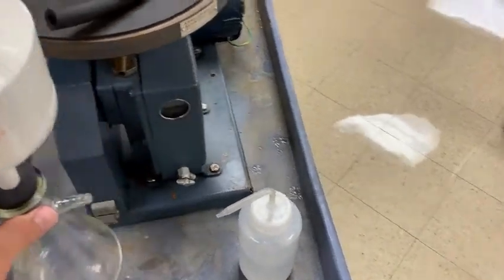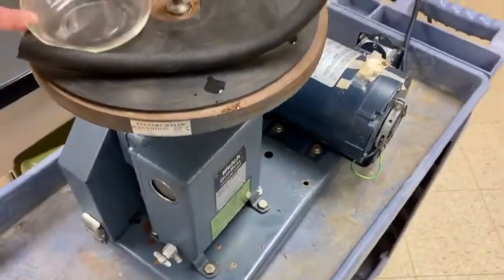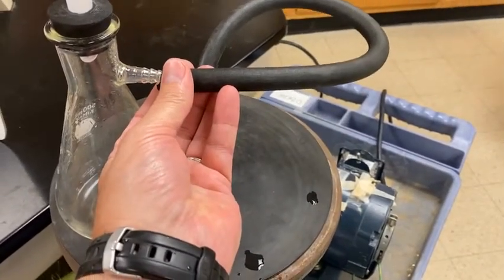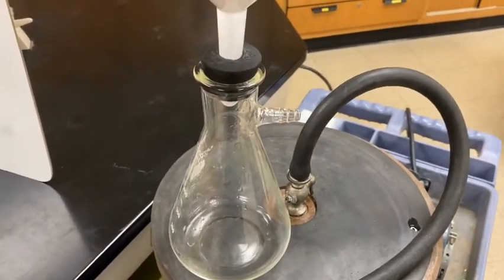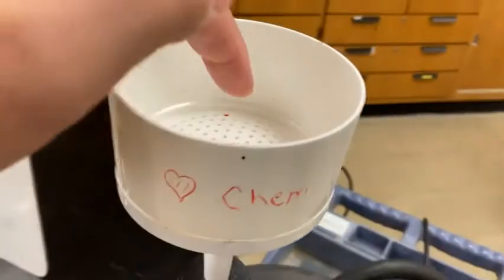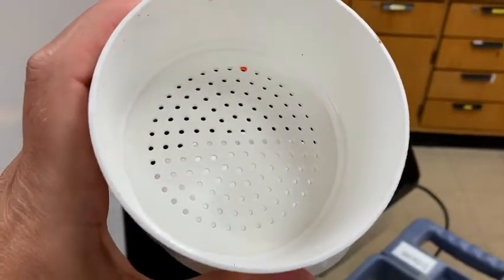And that is then connected into what we call a vacuum flask. And the vacuum flask, I'm going to be using our vacuum pump for this one. That gets a hose connected into the side, and when the vacuum pump is on, it starts sucking. It really sucks. Sorry. And what it does is it creates the vacuum, that suction downward, so whatever we put up here will actually be pulled through those holes and filtered.